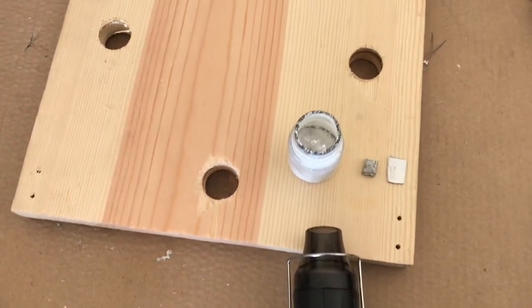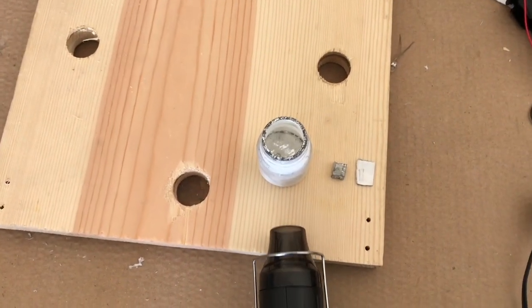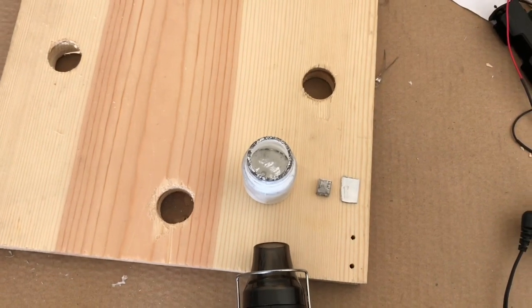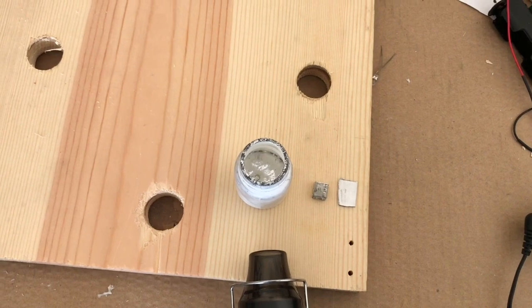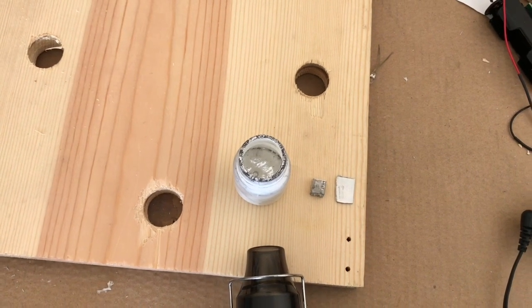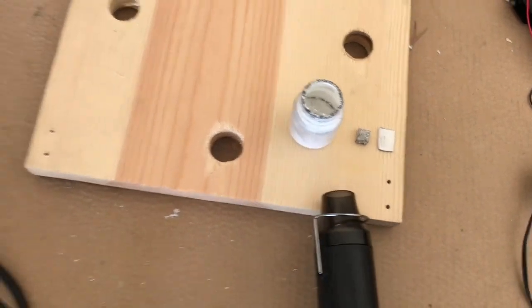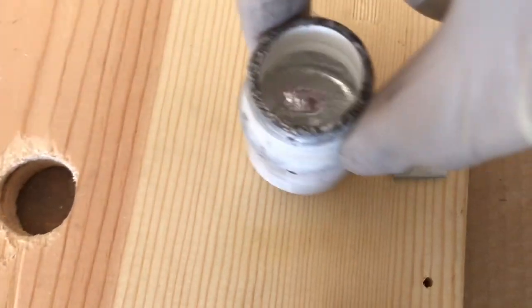So what I'm going to do is just further melt the gallium so it's easier to draw up into a small pipette and then to drip onto the magnesium and the aluminum. So let's go ahead now, let's drip some onto the aluminum.